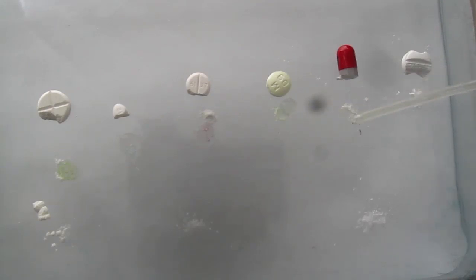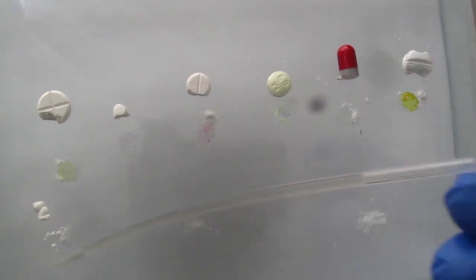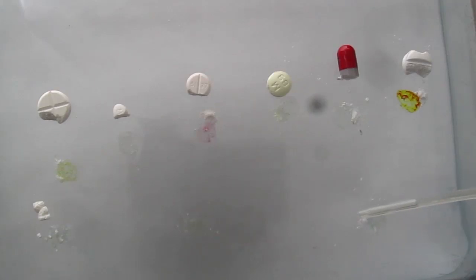and some of them don't even react at all. Like in the case of this Tylenol pill, did not even... this is the Tylenol? That's the Modafinil again. Ritalin changes a slightly faint yellow, sugar and sulfuric acid, I think you know what happens there, and aspirin again.